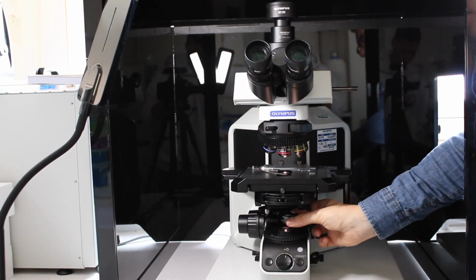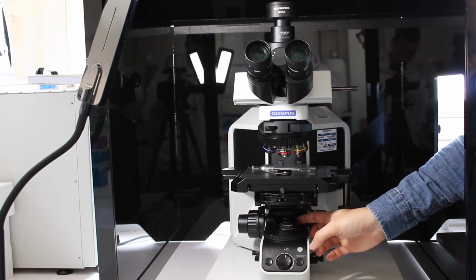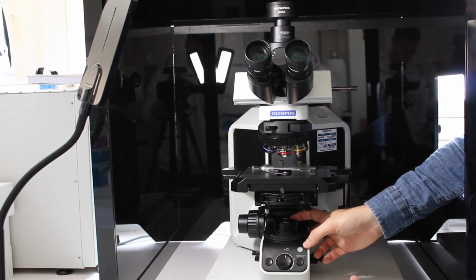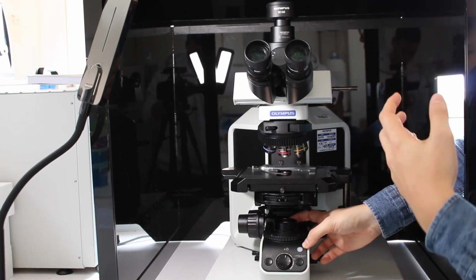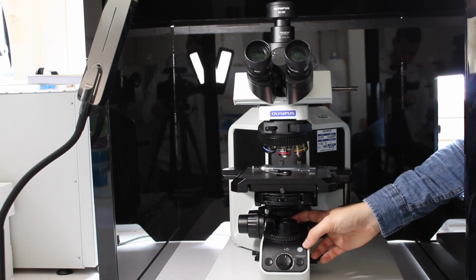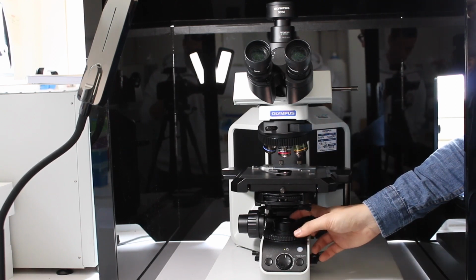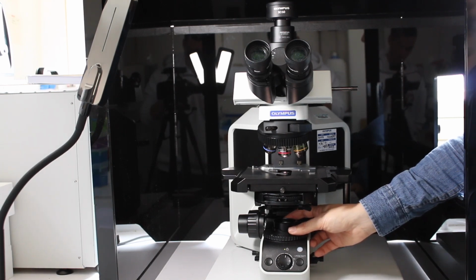This part you can put on top of the lens here. And this is the mobile part that you will be able to turn to look at the birefringence of your sample. Again, here you would first have to turn it so as to make the background completely dark, because the background is not supposed to be birefringent, so it should be completely dark. And then if your sample is birefringent, you will see light from the sample going to the eyepiece or to the camera.